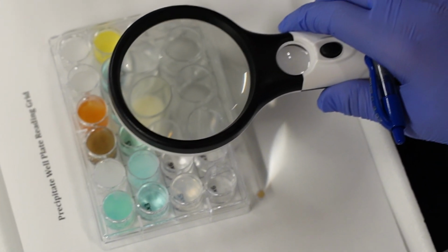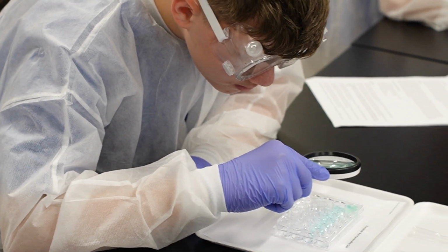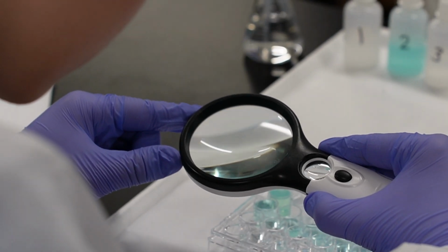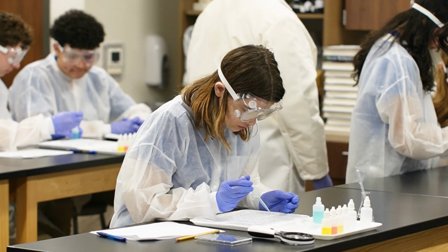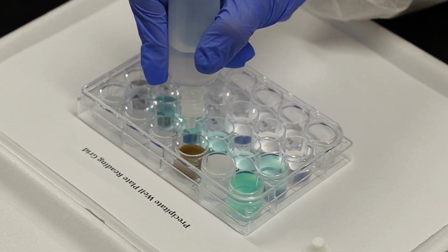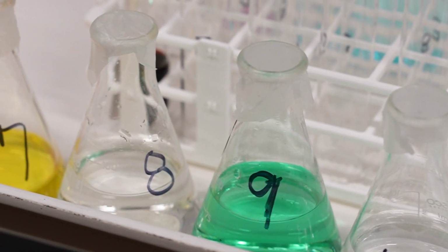And they have magnifying glasses to be able to then see, because sometimes those particles that form that precipitate, it's really, really fine and it might just look cloudy, but when they get in there, they can see these small microcrystals floating around inside the solution, so it really helps them, gives them some more information to record for the data in their observations. But at the end of the day, it's actually pretty straightforward. Pipettes, reaction wells, and just a lot of individual flasks that are going to have the unique solutions.